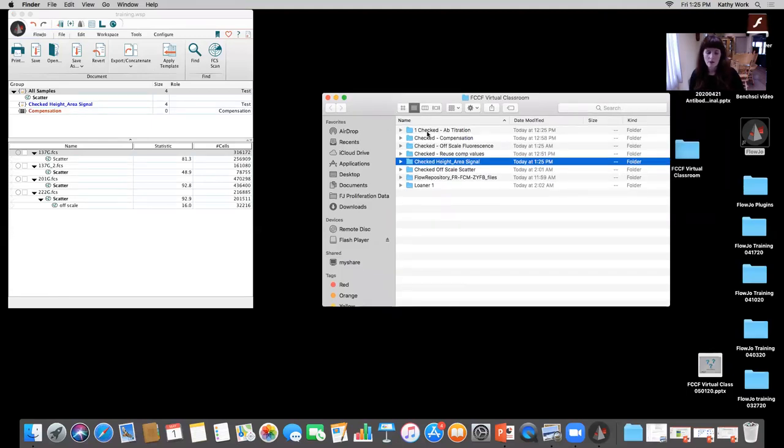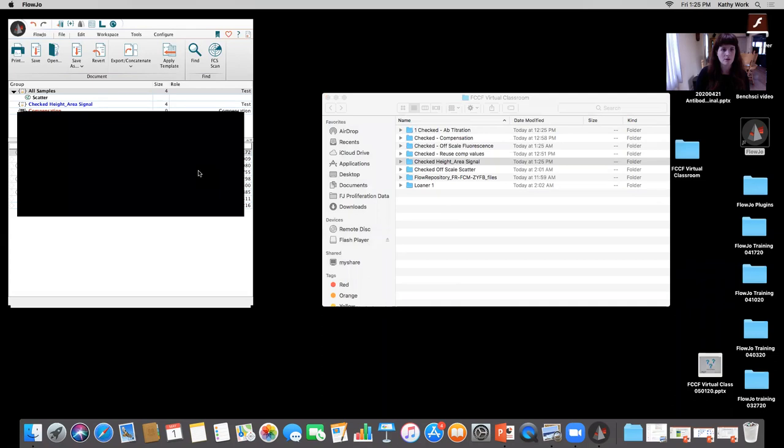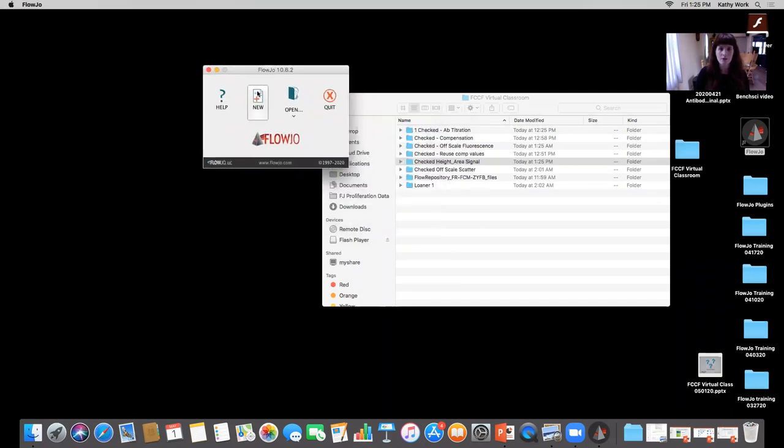So now our next topic is troubleshooting some titration data. I'm also going to utilize this opportunity to show you a cool plugin that I haven't shown in past sessions, but I think it's a good opportunity to show it now. Okay, so I'm going to close out of this workspace, save any changes, and then we'll do a new one.